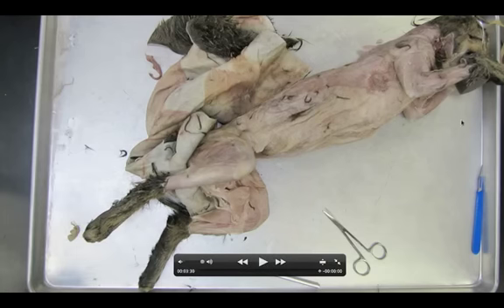This would be a great time to label these muscles. We have the gastrocnemius — this long, big, thick muscle right here. We have the flexor digitorum longus and the tibialis anterior. And back here is the Achilles tendon. So there are only four structures you need to know. The tibia — you already know that bone, but it's not going to be on your test. We'll see you guys in class for the dissection.